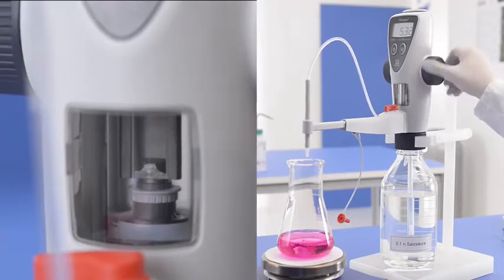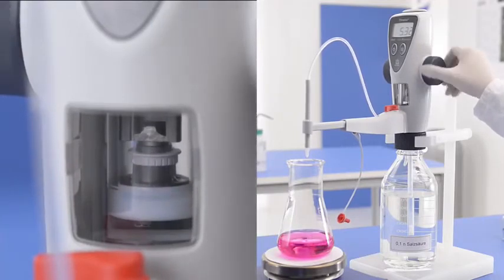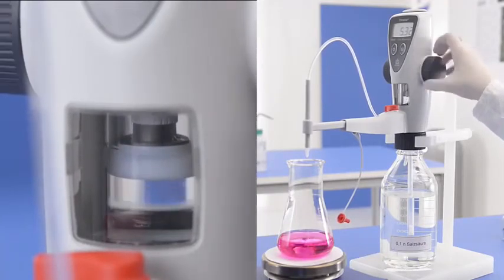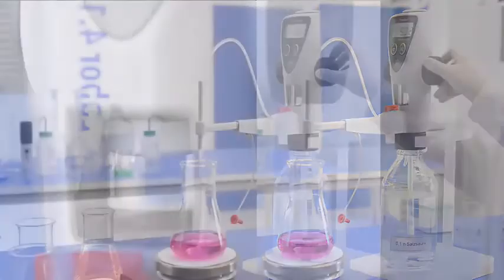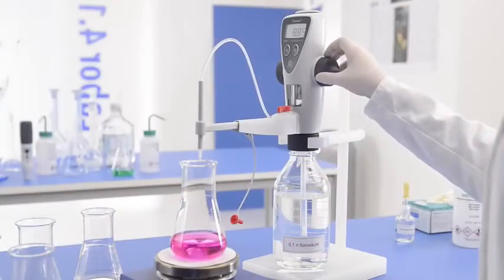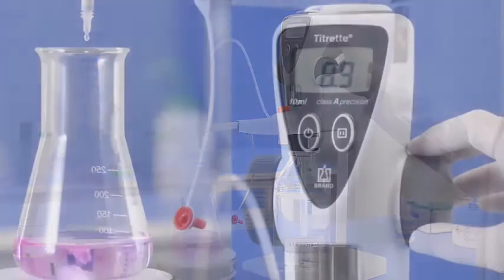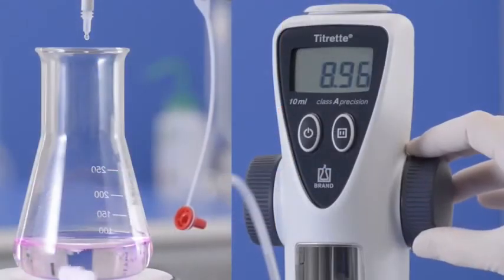In this case, simply raise the piston for filling. The display value will remain fixed during the filling process. The titration can continue as usual, drop by drop, with the highest possible precision.